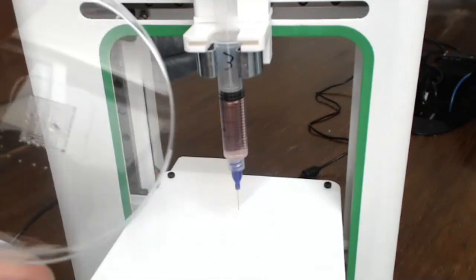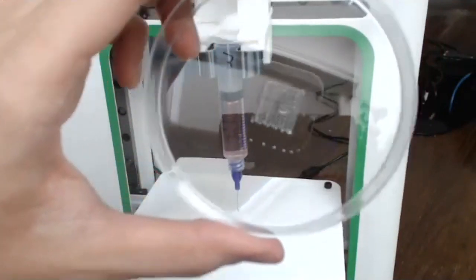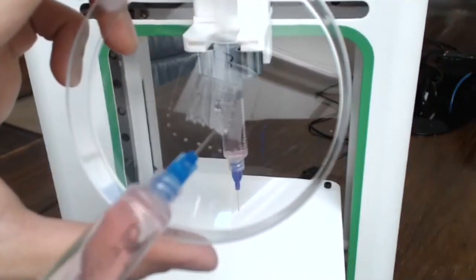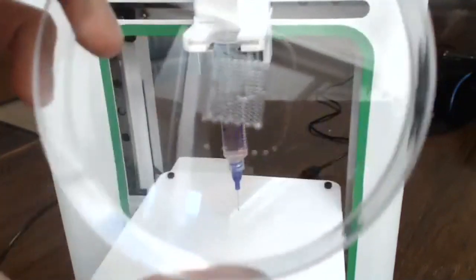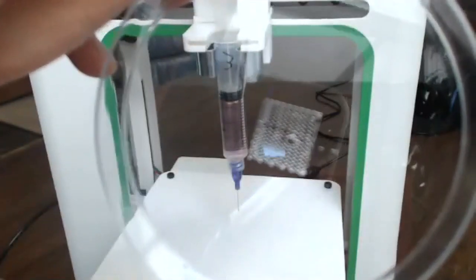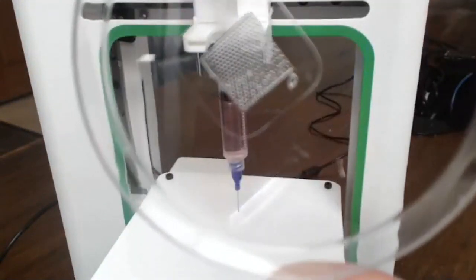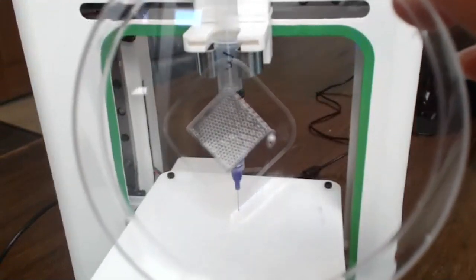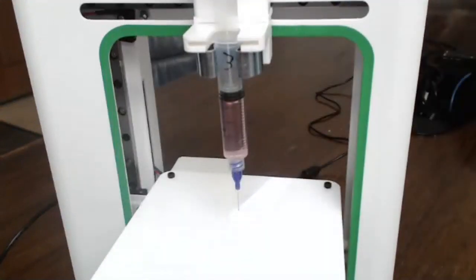Okay, so Oliver will show you. This one is the one with the faster speed. You can see how over here the perimeter hasn't exactly printed properly. And also you can see the skirt is skipping and bunching up because it hasn't really contacted the petri dish well. So as Oliver highlighted, that previous print scaffold was a lot more uneven, and this is the one that has the better printing conditions, so it's a lot more even.